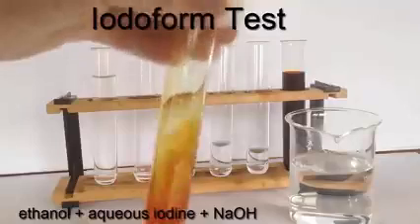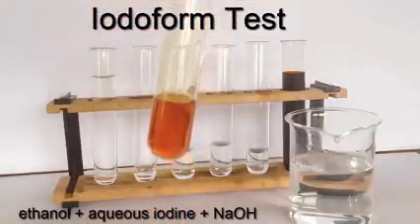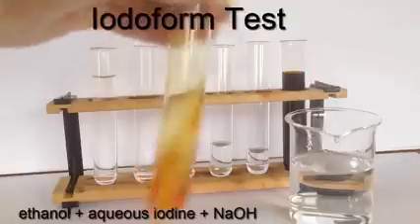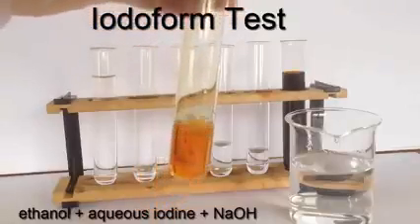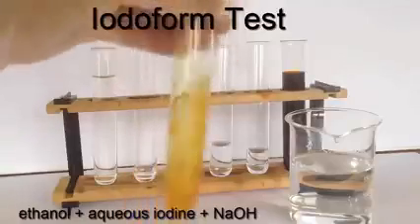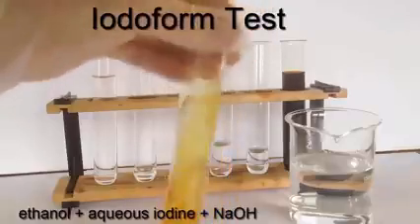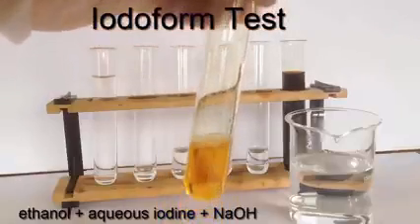And the question is, is it simply going to fade and produce a colorless solution, which would be a negative test? Or is it going to get lighter and brown and actually then produce a yellow precipitate, triiodomethane, that has an antiseptic smell? So let's see.